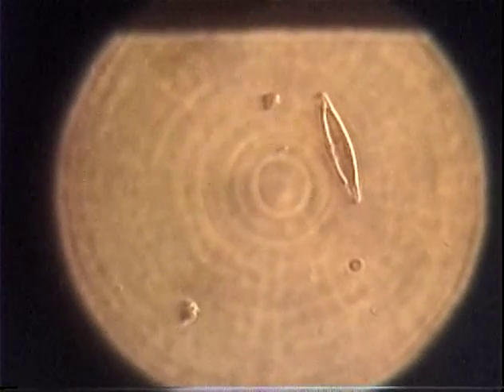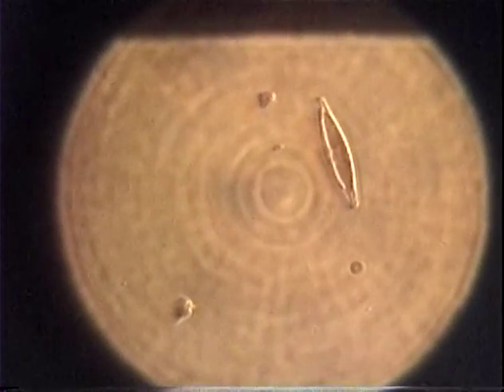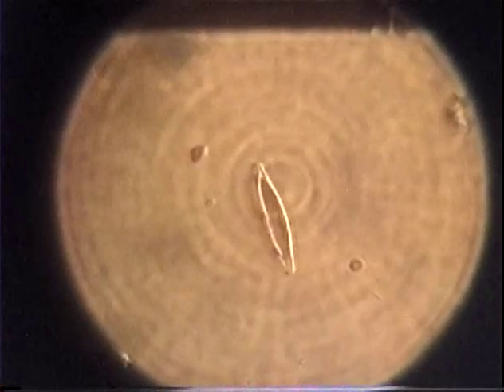This one's hiding completely. You got down in the shade of that clump of algae. You got into that algae and got away from us. Sooner or later it'll have to come out. No, they can stand there forever. And this is from Aeoshus. The first one we looked at was Denny's, and you notice you get the same organism in Aeoshus as well as Denny's.